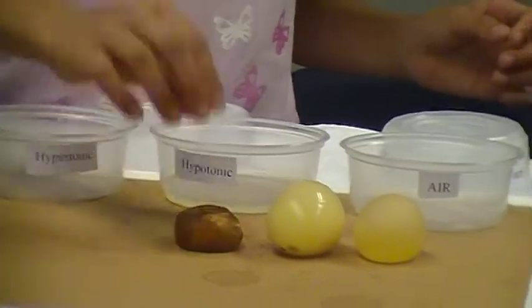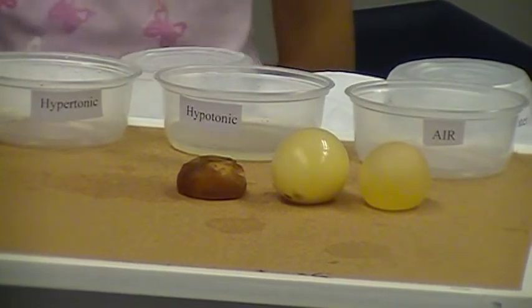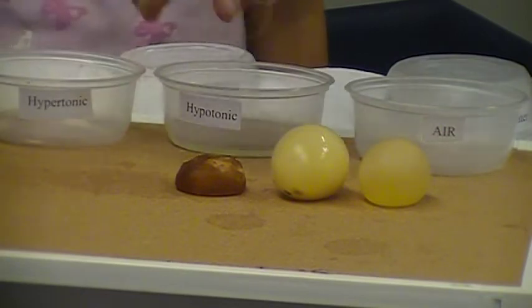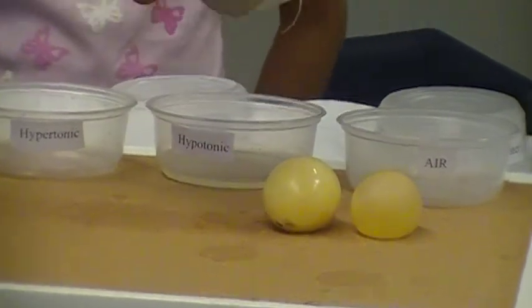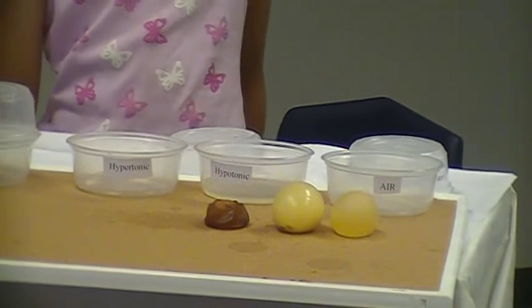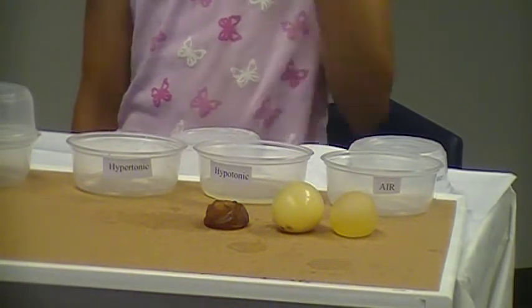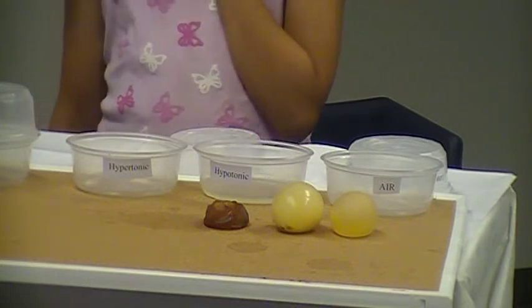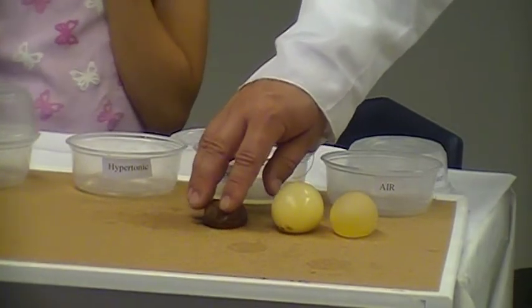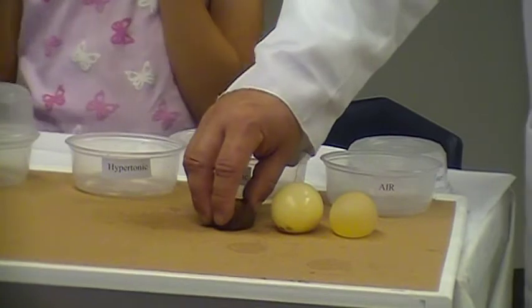Let's take a look at the third egg — the Karo corn syrup egg. Julia, can you take that egg out? The Karo corn syrup that this egg has been sitting in is basically nothing more than a sugar solution. And as you can see, the egg that has been placed in what we call a hypertonic solution — this sugar solution — is all shriveled up and has become dehydrated. The reason for this is also osmosis. However, in this case the water, instead of moving through the cell membrane into the cytoplasm, moved in the opposite direction — out of the egg cell through the membrane and into the corn syrup solution. The egg cell, in an attempt to bring balance, allowed water to exit through its semipermeable membrane and enter into the Karo corn syrup solution.